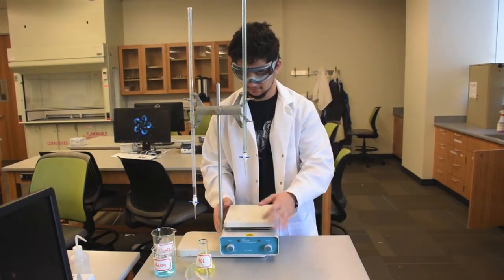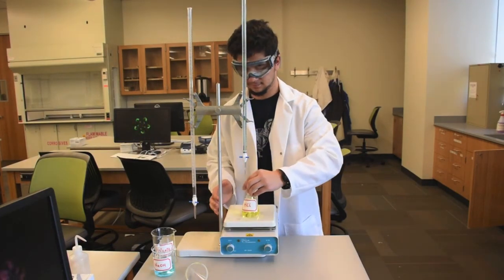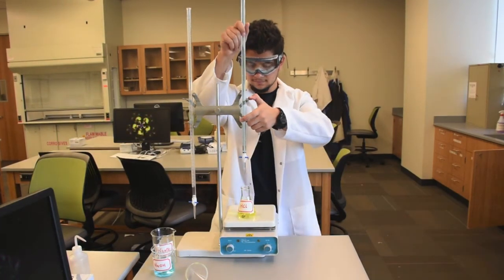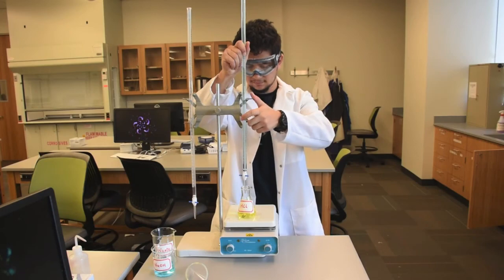Your burette is now ready for your experiment. Thank you for listening and I hope that this video will strengthen your burette preparation skills.